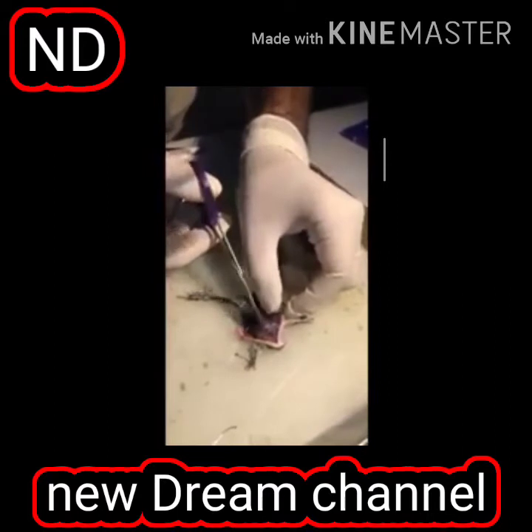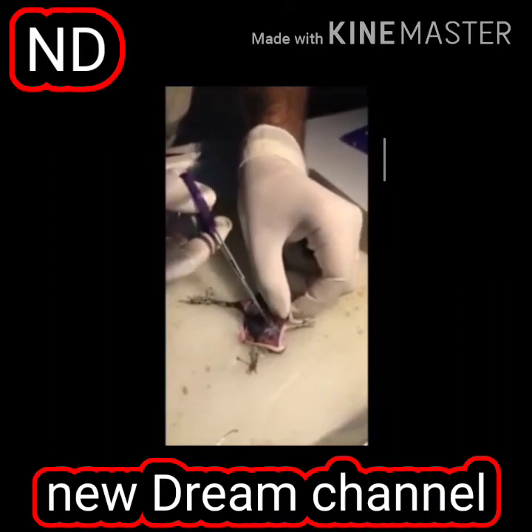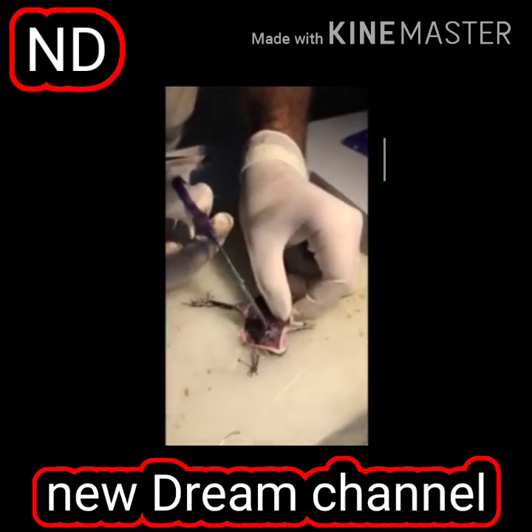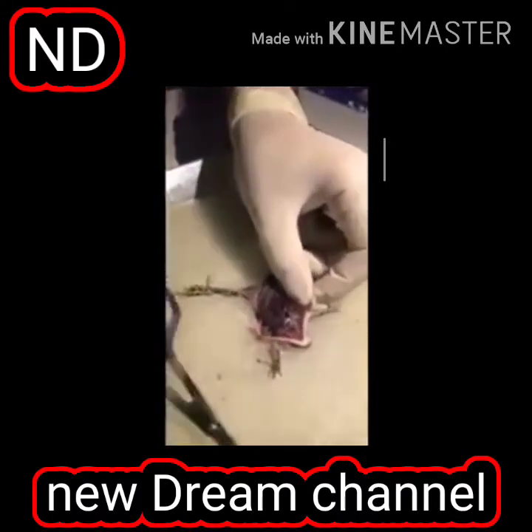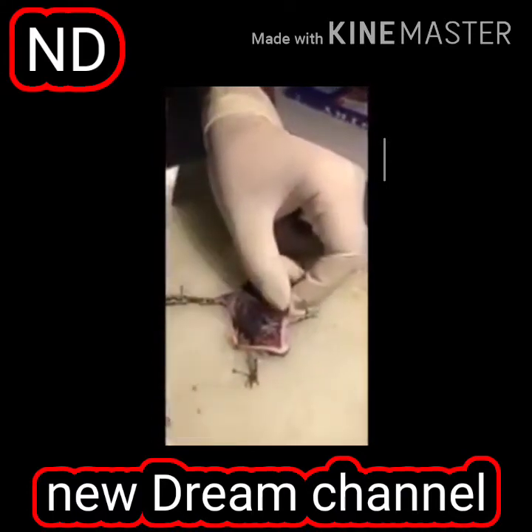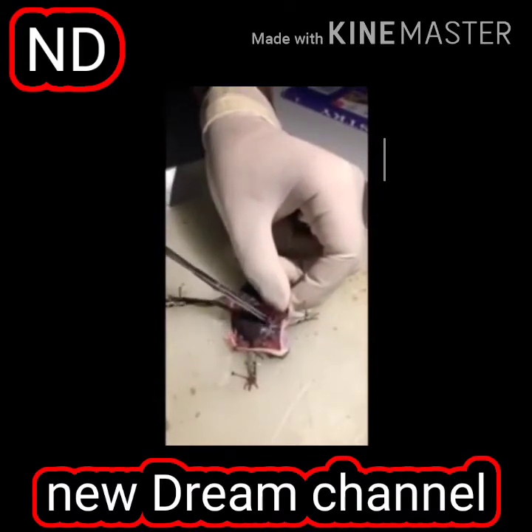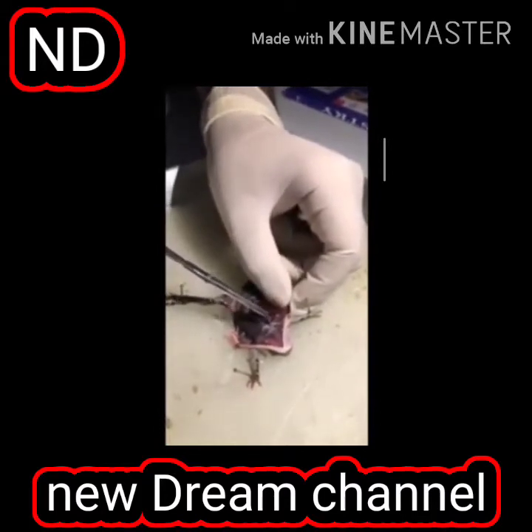This is heart. If I prick it, it will beat. It's a myogenic heart. You can see the heart. If you see it properly, yes, heart is beating. You are visualizing the three-chambered heart. इसके पास three-chambered heart होता है.